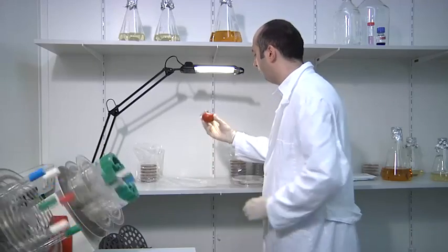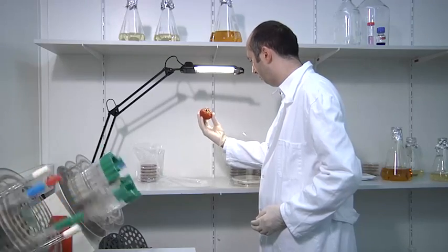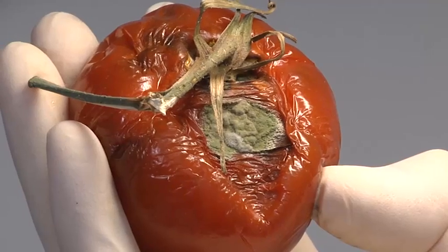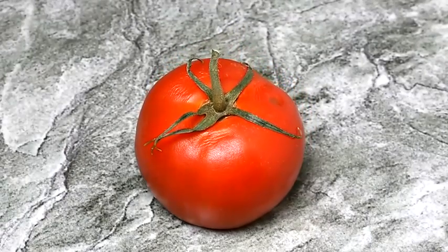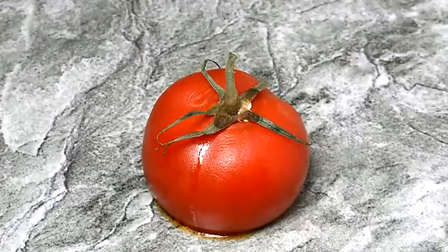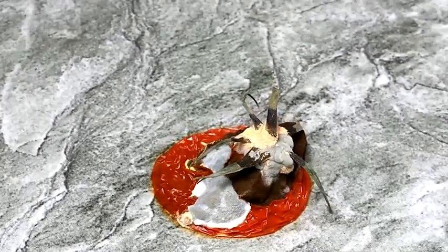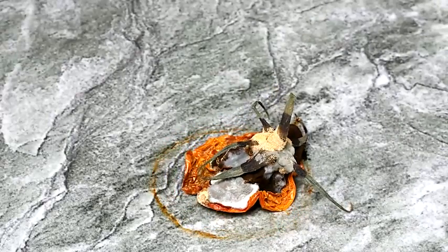In our lab, we are working with a saprophytic filamentous fungus called Aspergillus nidulans. In nature, it grows on decaying organic materials. To demonstrate this, we infected some fresh fruit and kept it under room temperature for a couple of days. In this time lapse, you can follow the fungus as it grows and spreads over the decaying fruit.